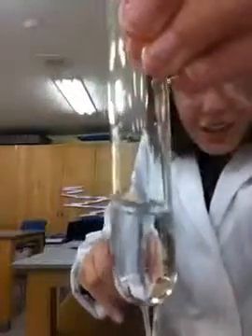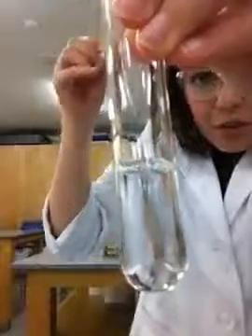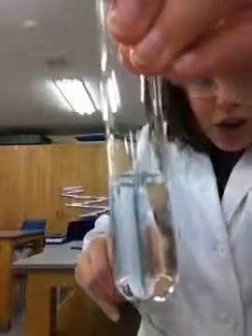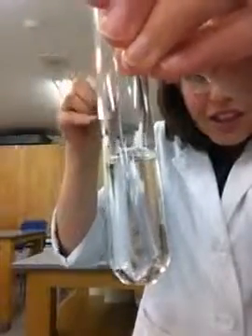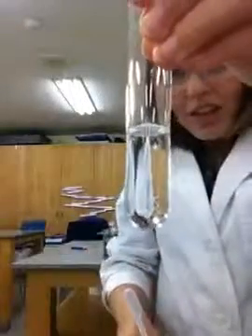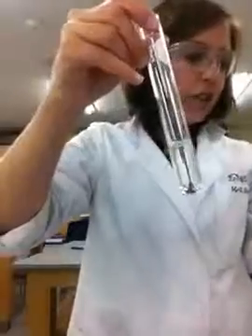Let's see if I can get it closer up for the second one. All those fizzy bubbles of carbon dioxide coming out of this carbonate. This is essentially an acid-base reaction. There we go. Producing carbon dioxide as the carbonate is reacting with the acid in hydrochloric acid.